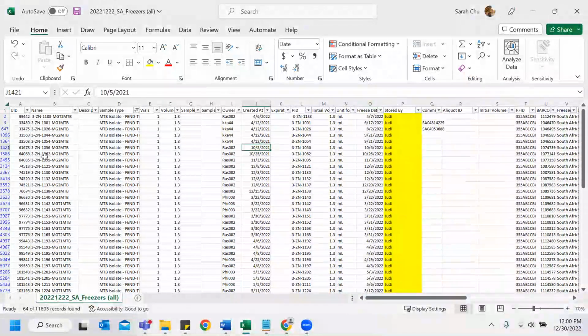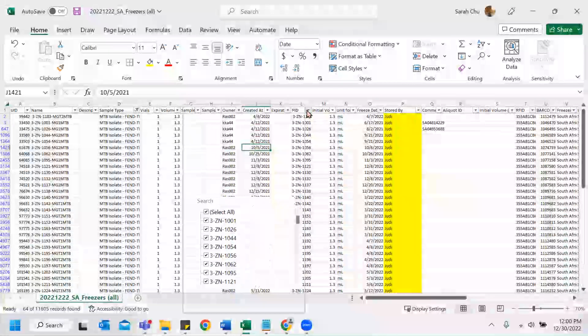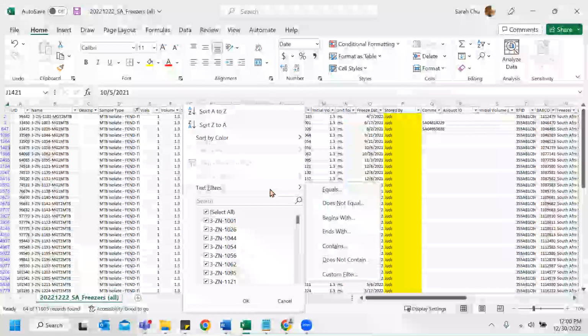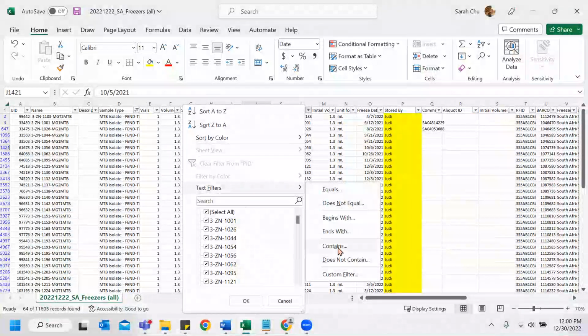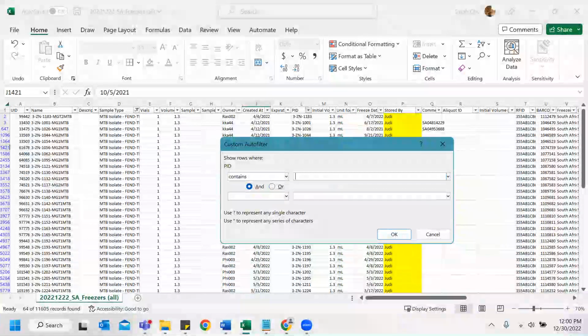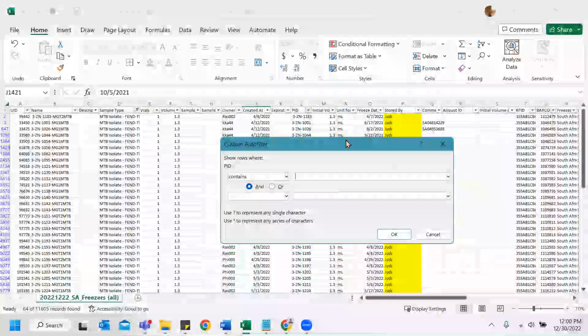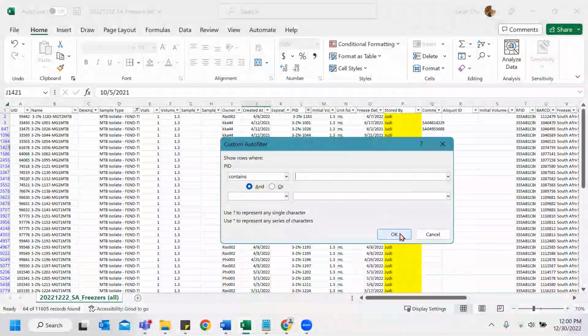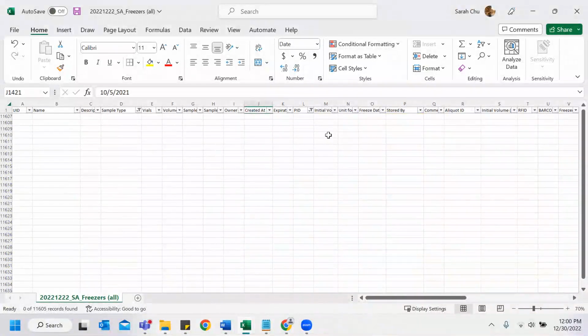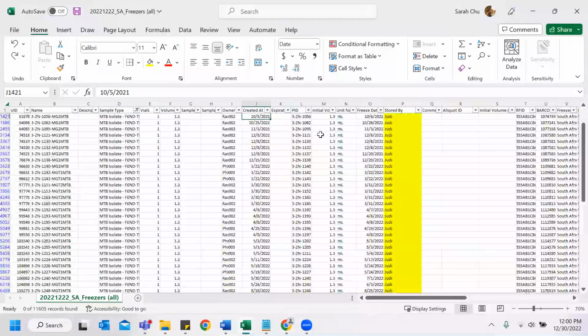And one more thing I usually do sometimes is for PID, text filters. For some columns, what I do is filter if it contains a space. Sometimes, for some reason, spaces won't show if you click on the filter, so I do this as a measure just to make sure. Nothing contains spaces. We're good.